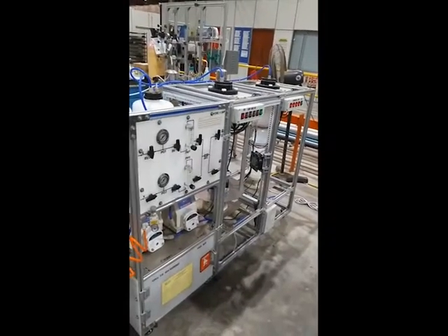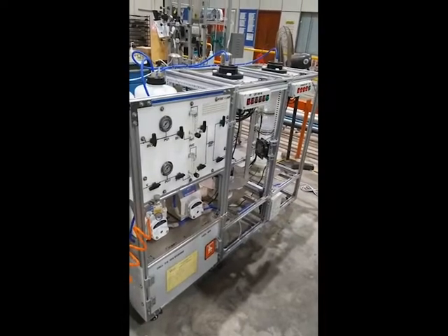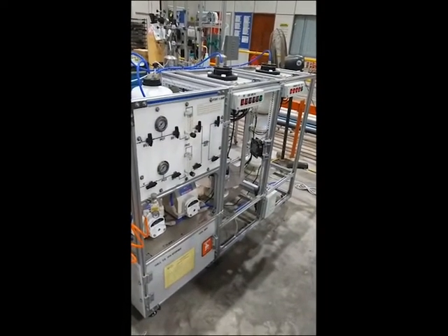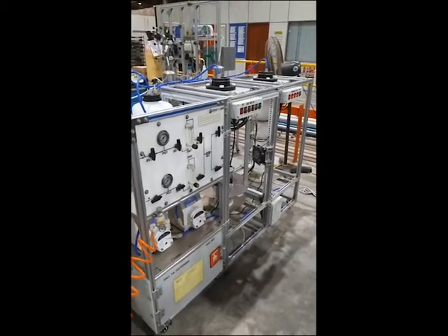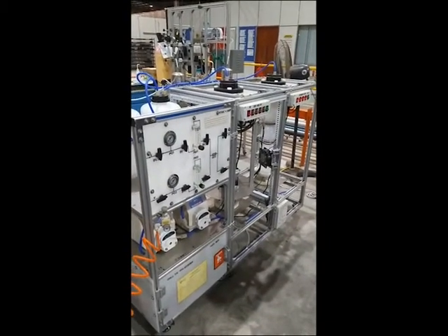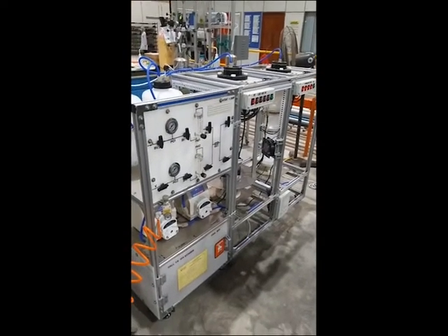Today we will introduce the best type optical reactor. This reactor was designed for two reactors used separately: one is a standard LED radiation reactor, and one is a wireless floating optical LED reactor.